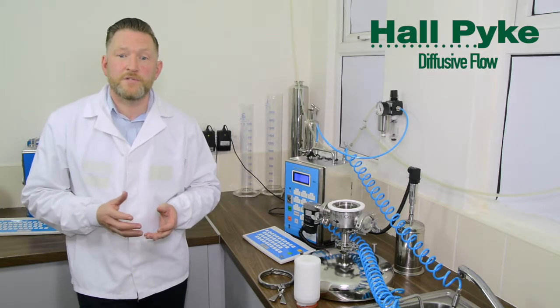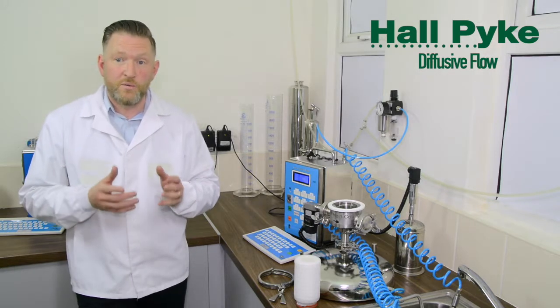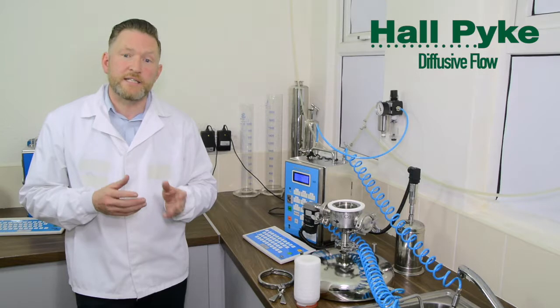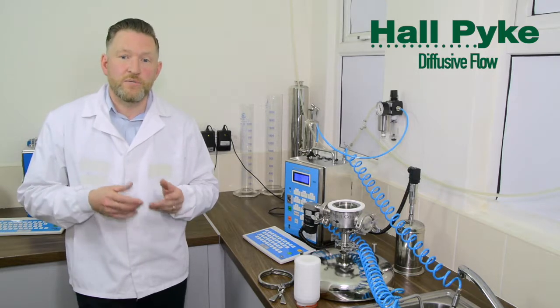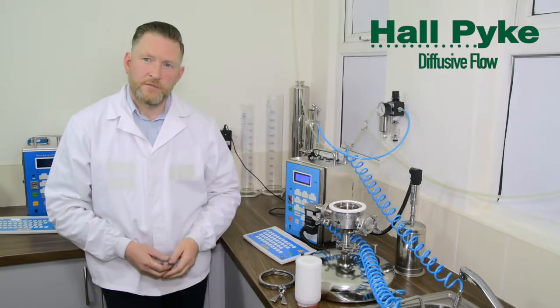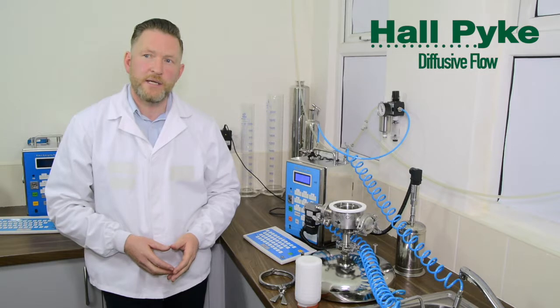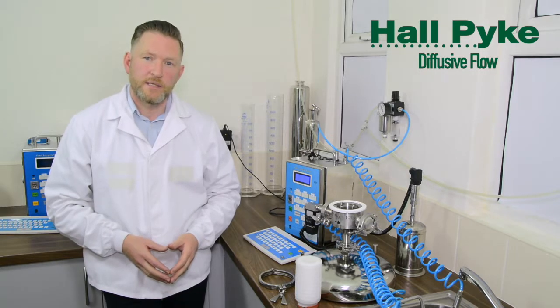The test parameters for sterilizing grade membrane filters are based on correlating the test parameters with the LRV of the filter against a 10 to the 7 CFU per centimetre squared challenge, Brevundimonas diminuta. The filter cartridges are tested by industry standard procedures as recommended in the PDA Technical Report 26. The test parameters are dependent on the surface tension of the wetting fluid to be used.